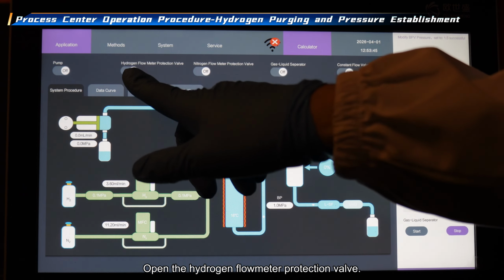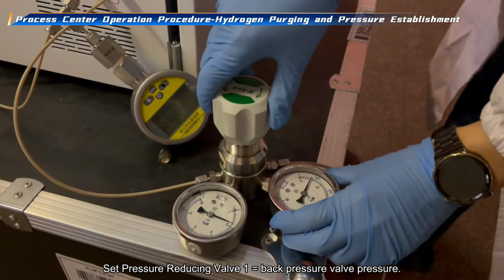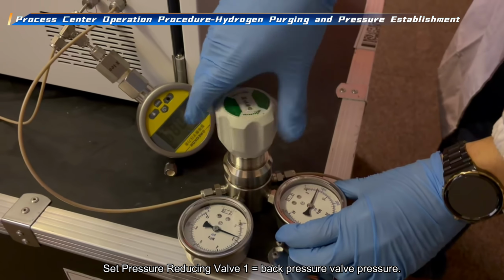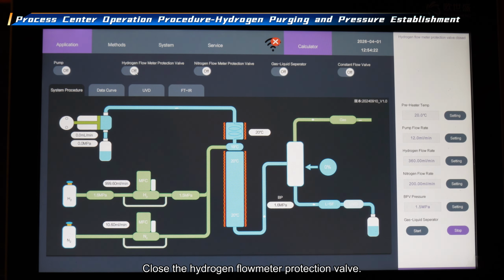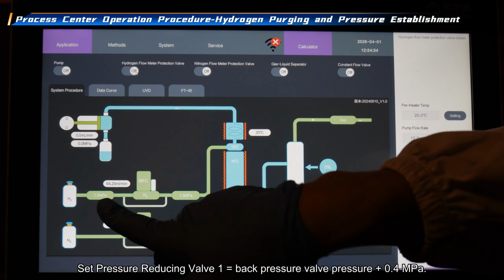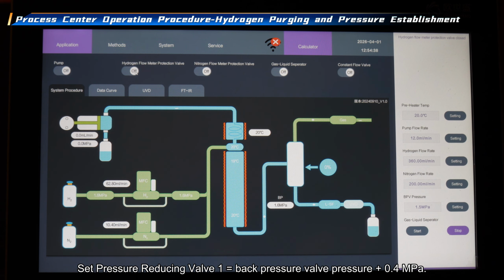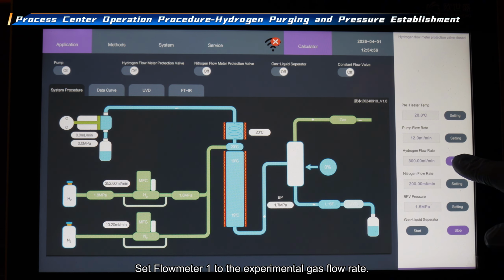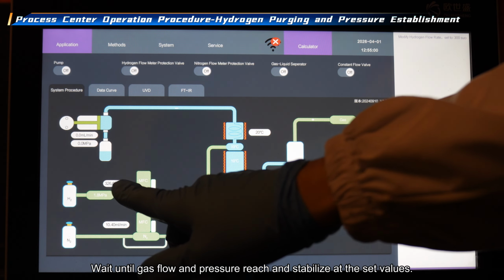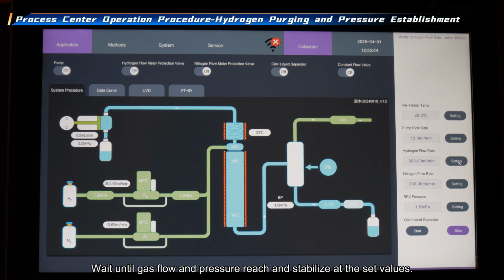Open the hydrogen flow meter protection valve. Set pressure reducing valve 1 equal to the back pressure valve pressure. Close the hydrogen flow meter protection valve. Set pressure reducing valve 1 equal to the back pressure valve pressure plus 0.4 megapascal. Set flow meter 1 to the experimental gas flow rate. Wait until gas flow and pressure reach and stabilize at the set values.